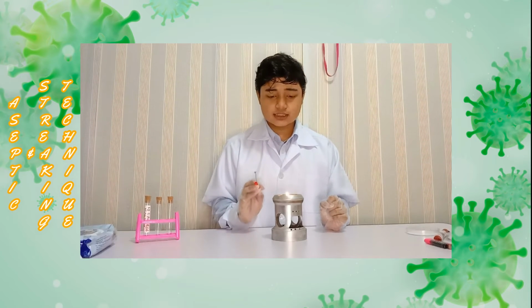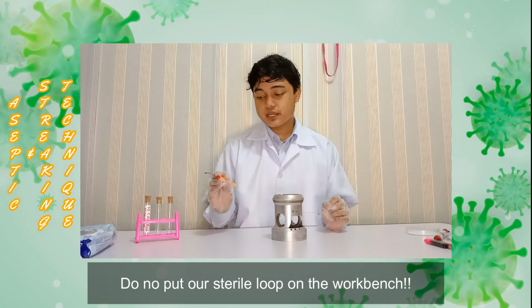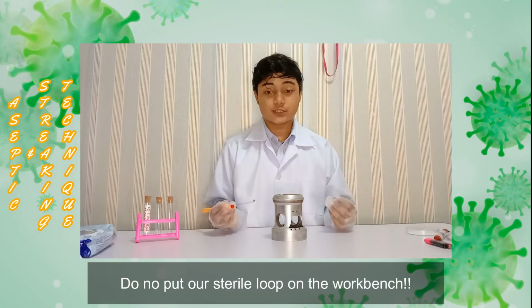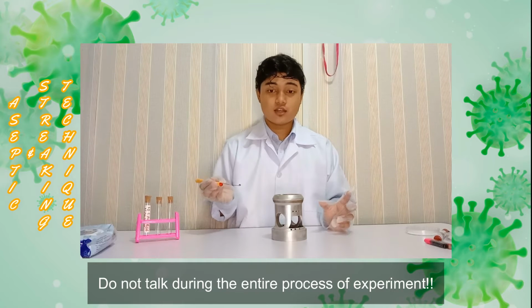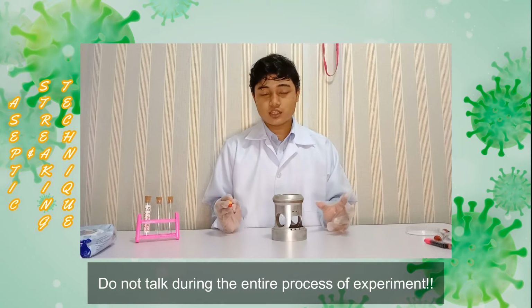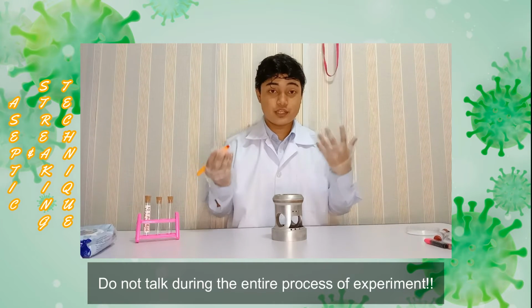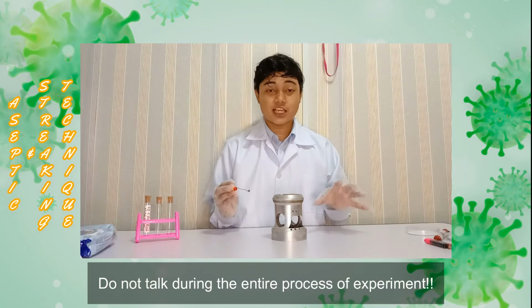There's one thing that is very important. After we sterilize our loop, don't put our loop on the workbench because we want to avoid any contamination to our experiment. When we hold the loop or transfer the bacteria, make sure we don't talk, so that there's no contamination, because bacteria will come out from our mouth. But for this experiment, because I want to explain, I will talk.